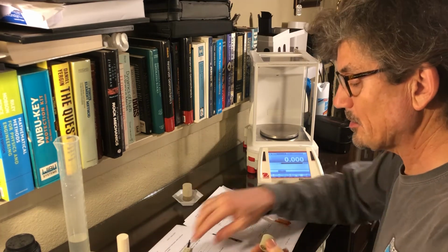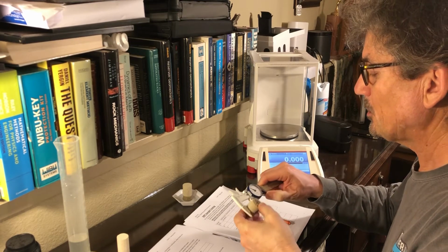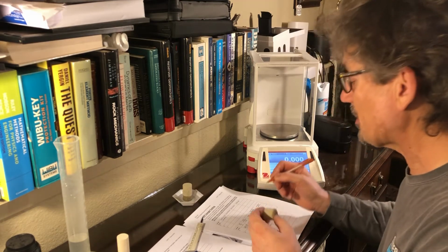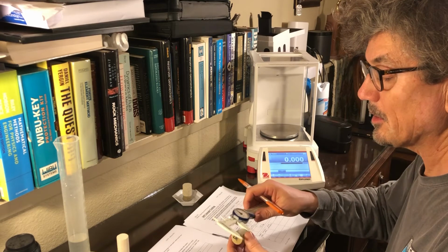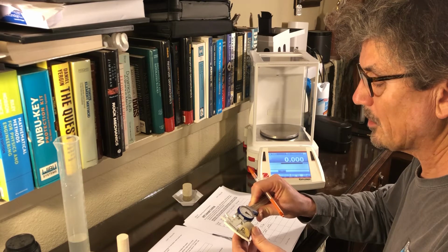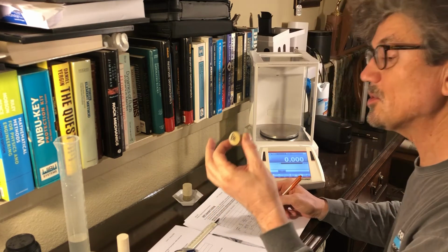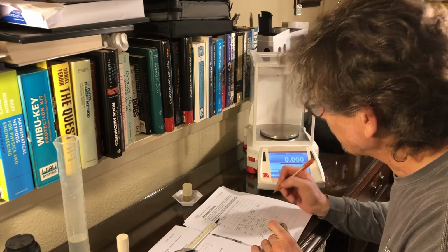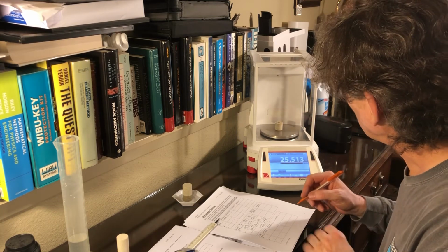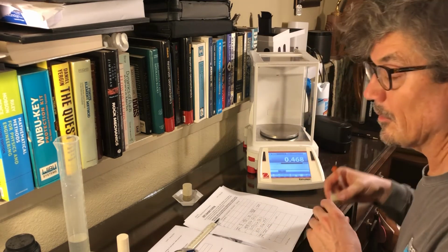I'm going to do one more sandstone sample. And I presume 25.1 is the diameter, so just round it off to the same 12.6 millimeters for the radius, and then 24.7 is the height. You can see this is just 1 inch tall, so 24.7 millimeters, and then the mass, 25.51. Okay.